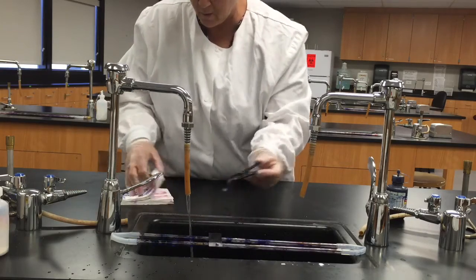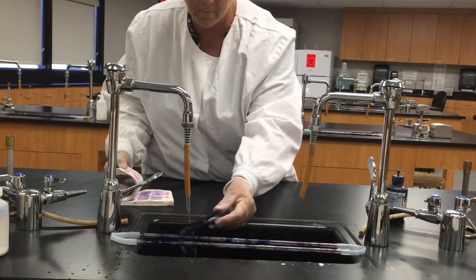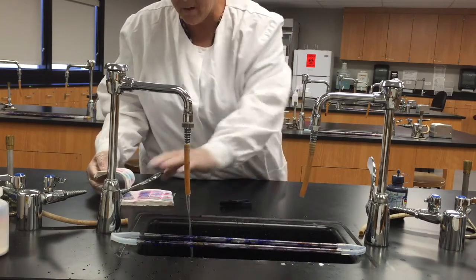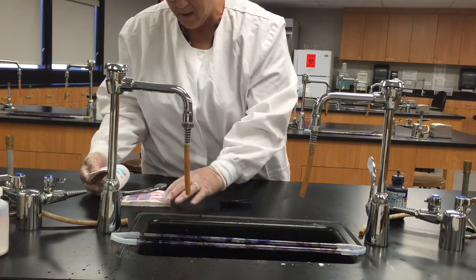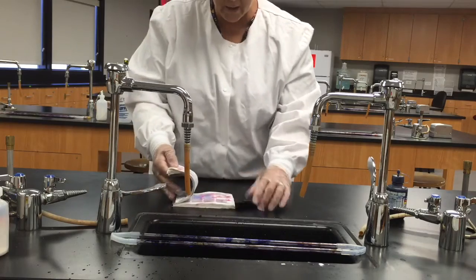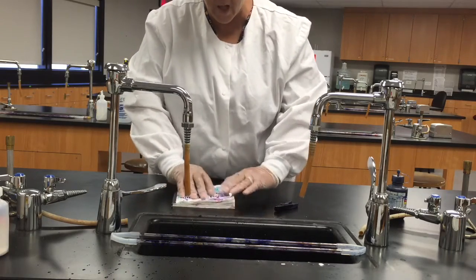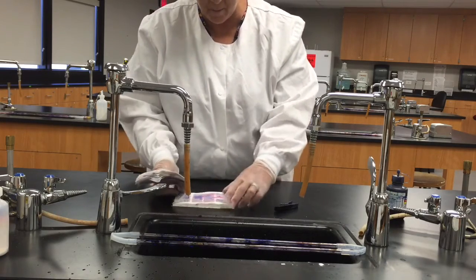All right, just gentle rinse. Front and back, get all those slides in there. And I'm just going to gently blot them, I don't want to press too hard or I'm going to break the slide. And I don't want to rub from side to side or I'm going to rub the smear right off onto the bibulous paper.